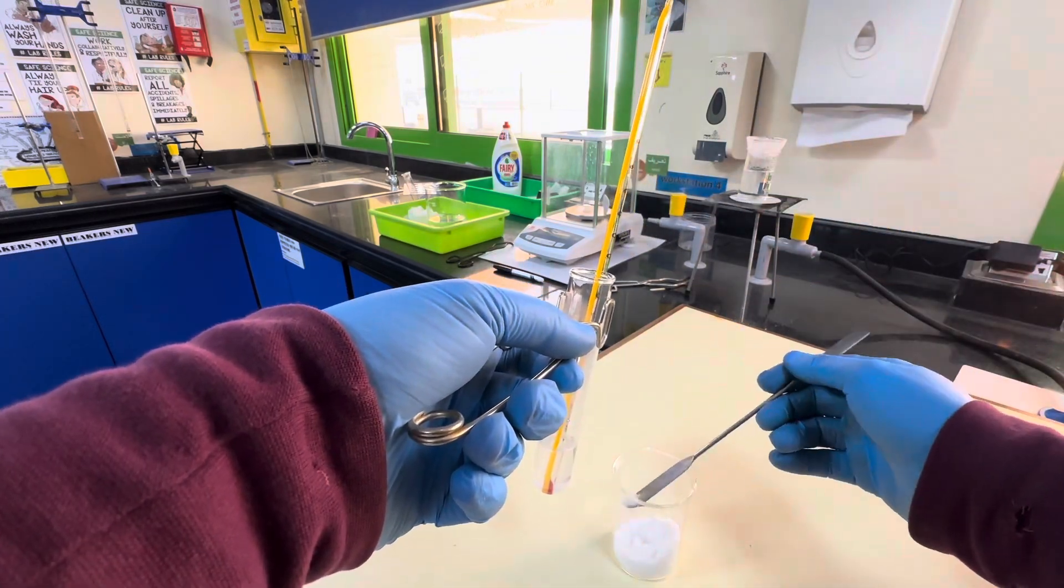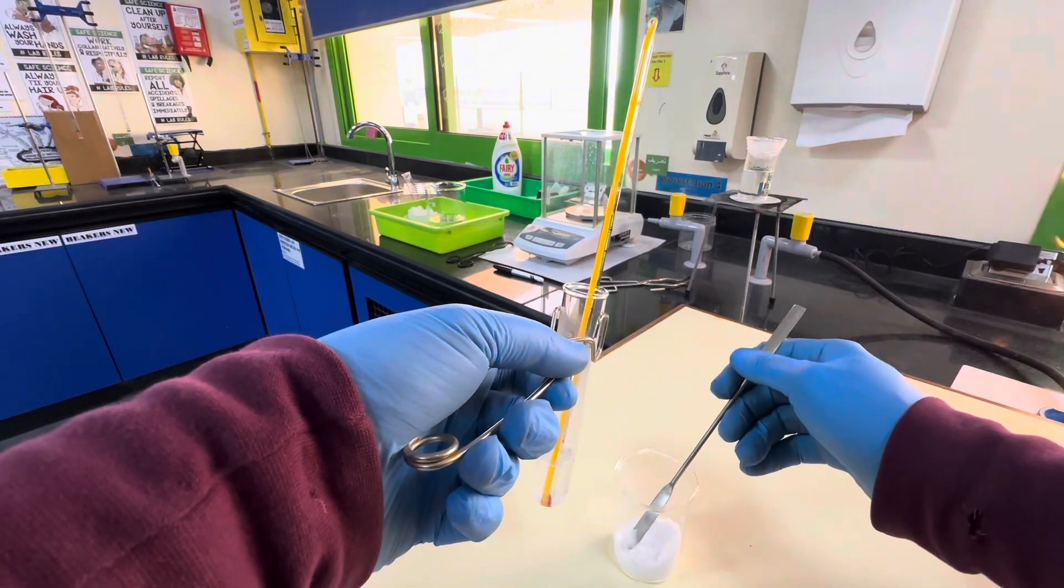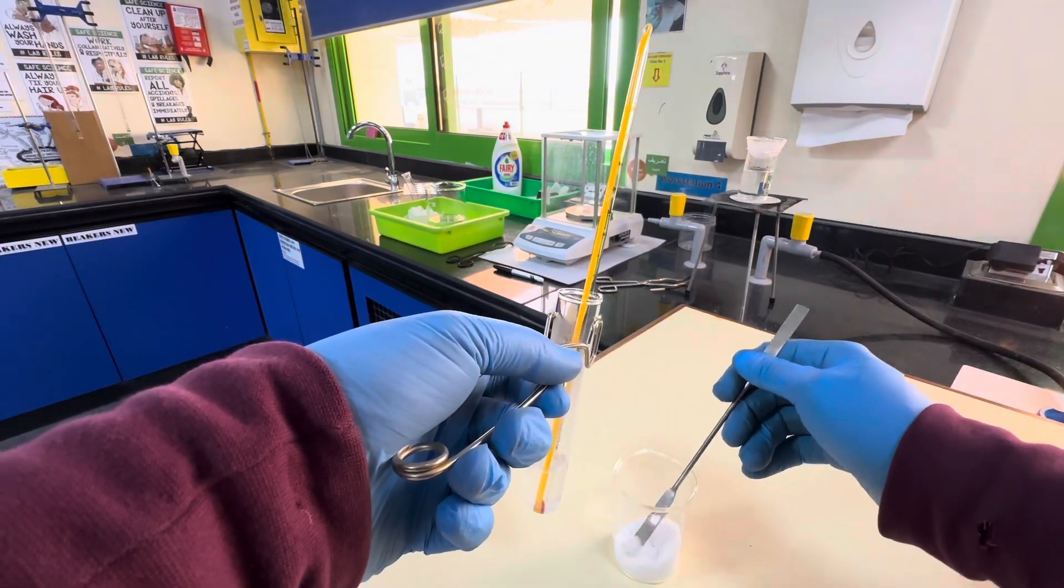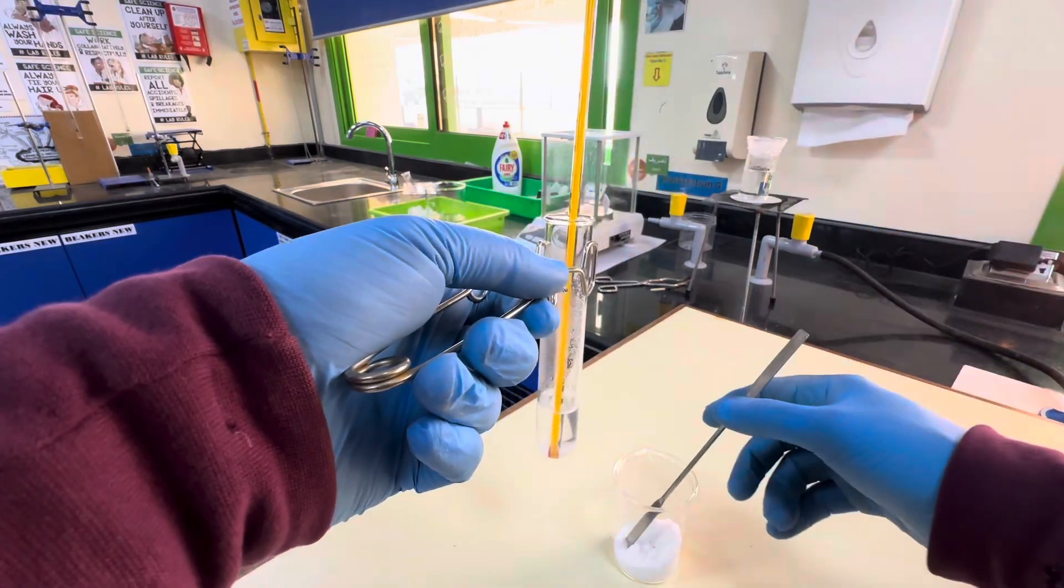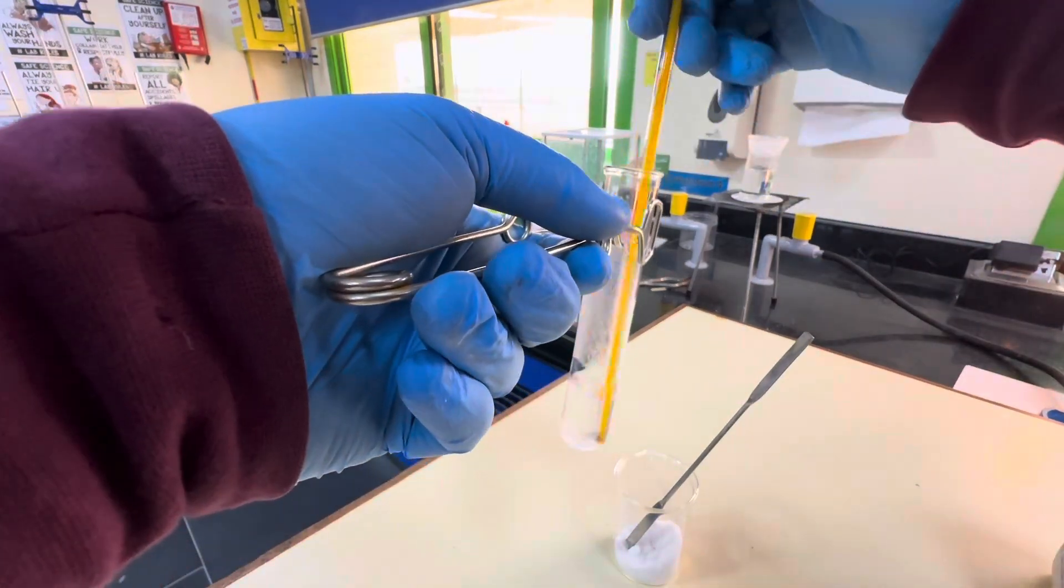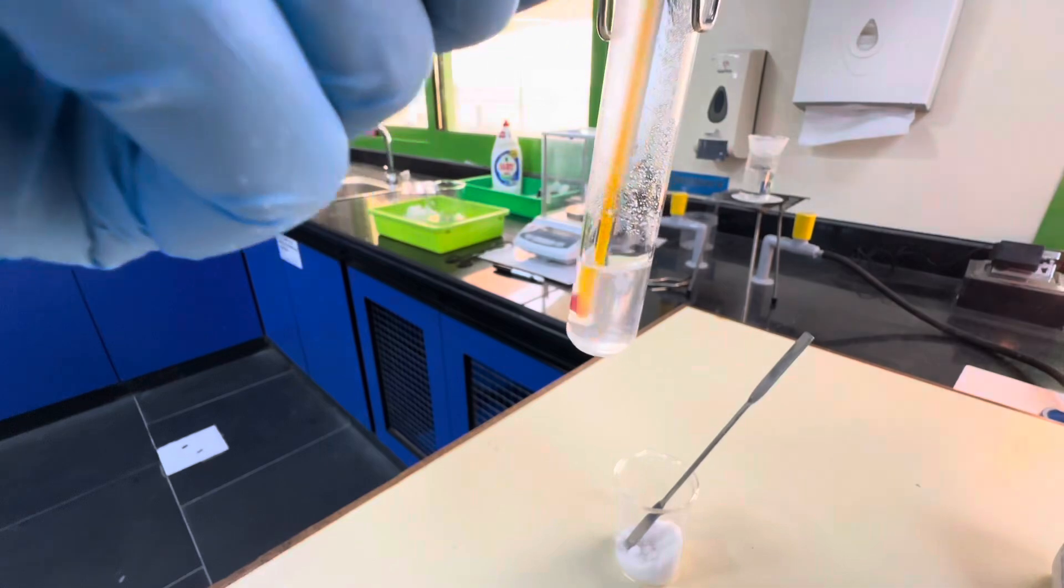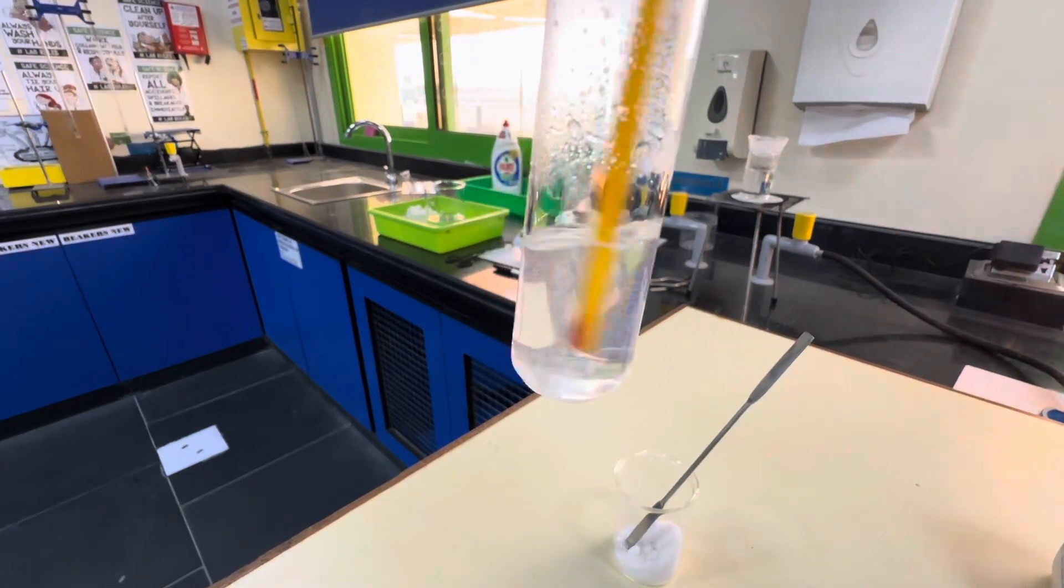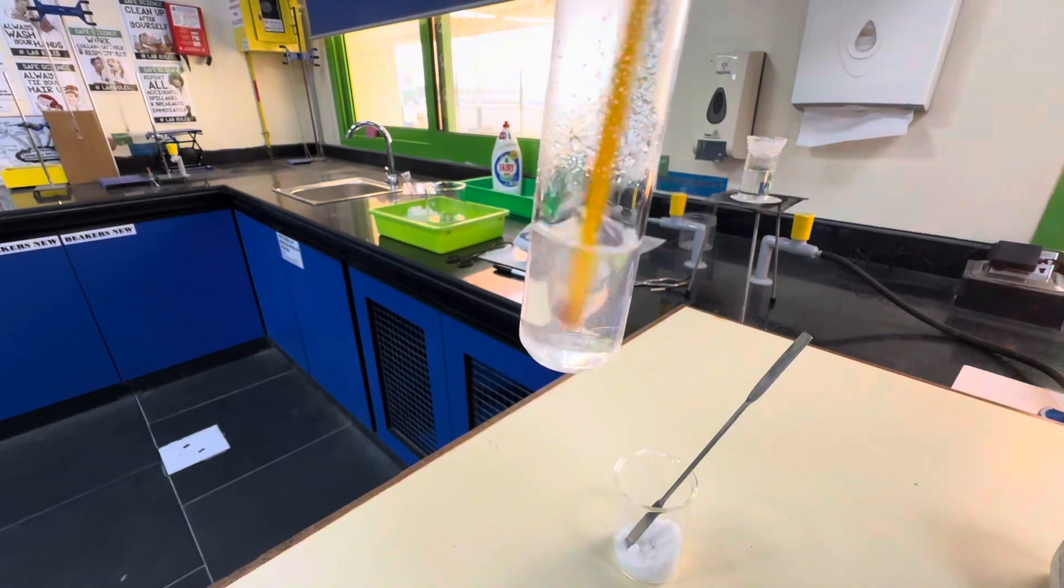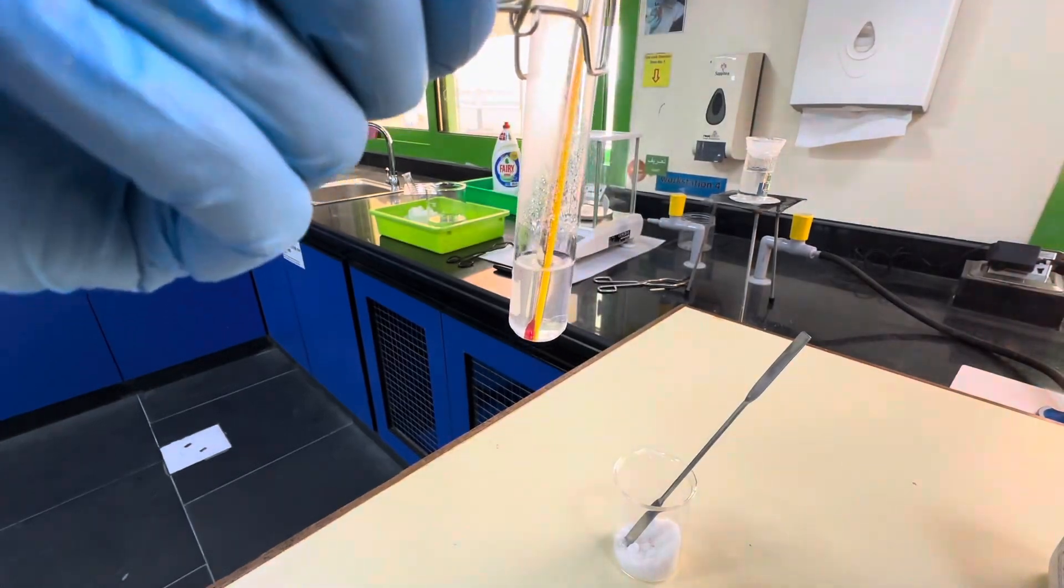I'm hoping that I don't have to heat it again. I'm hoping that it will very quickly form a saturated solution. I'll give it a stir. You can see that it's actually dissolving. So I'll need to add a little more. I'll keep doing this until I've got a saturated solution.